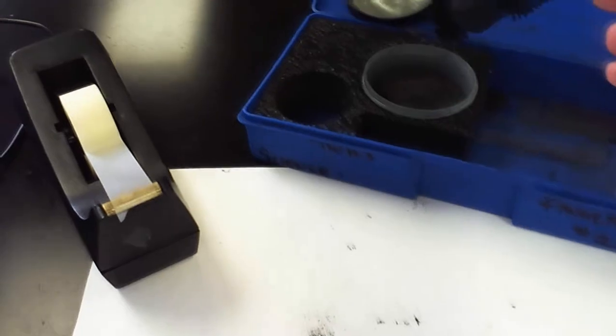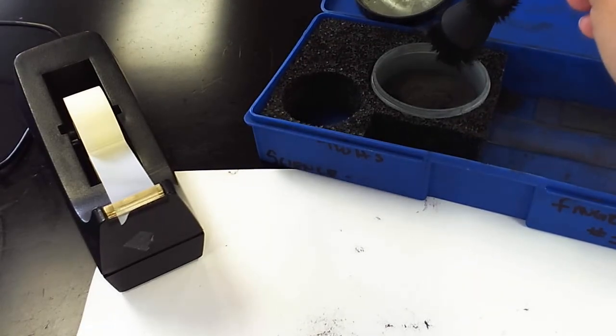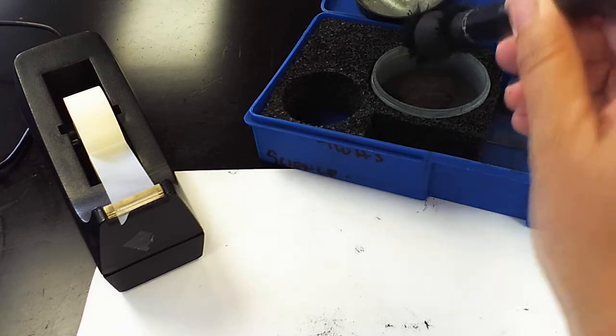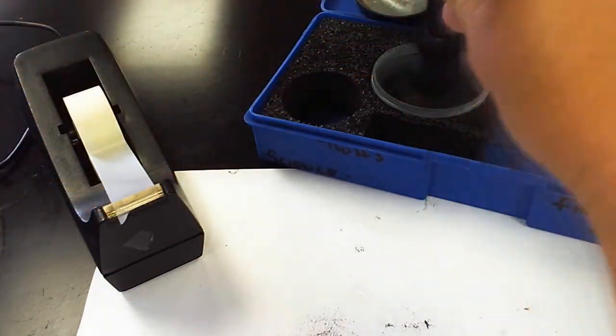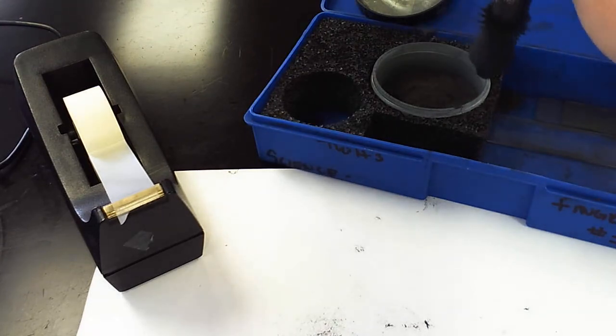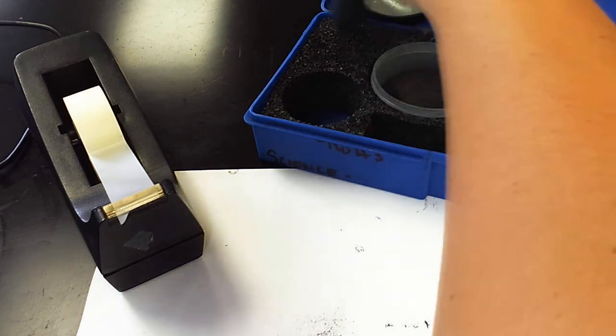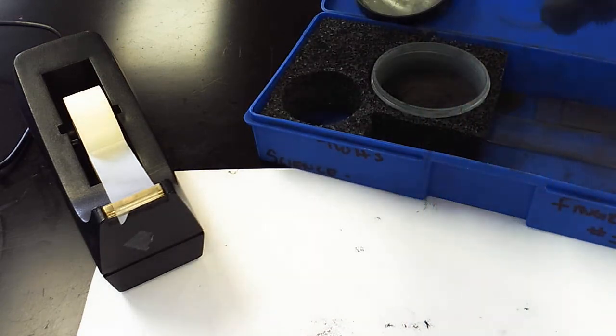Then, here's a big important cleanup part. You want to take this wand over top of your powder dish. On the end there is a knob. You can actually pull up on that knob. When you pull up on that knob, it releases the powder back into the container. You can even clean up a little bit by rubbing this around and cleaning up your container.